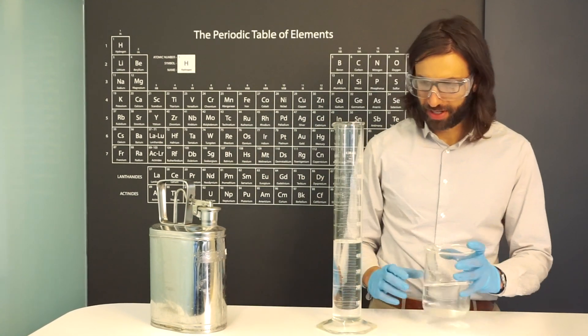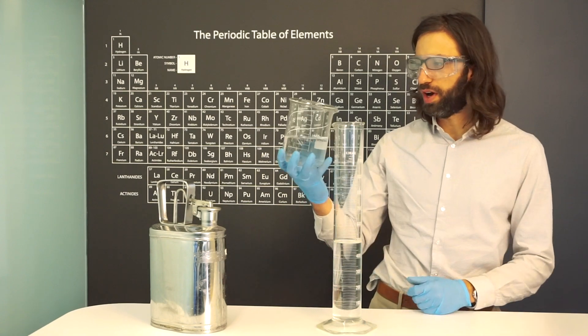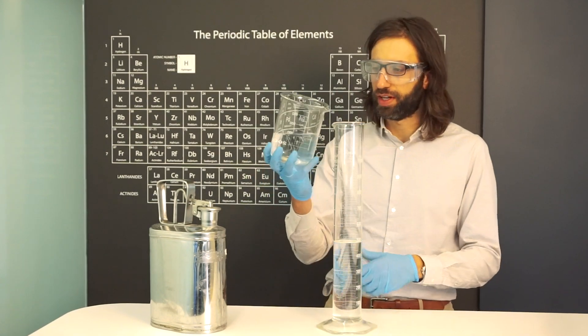Okay, so now we're going to mix the two. Water and ethanol are miscible, meaning they're soluble in one another, completely soluble.